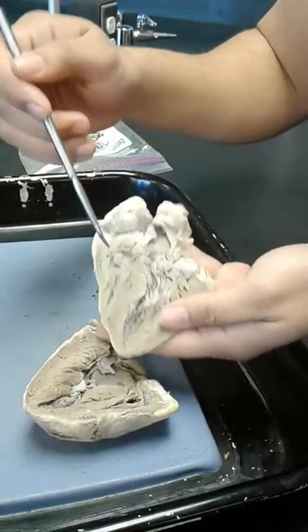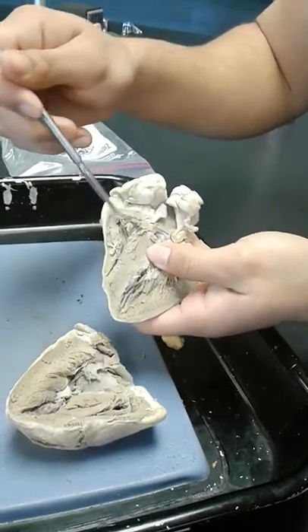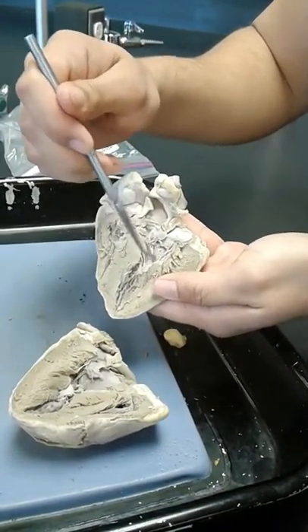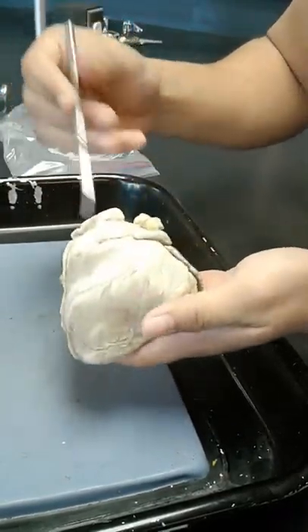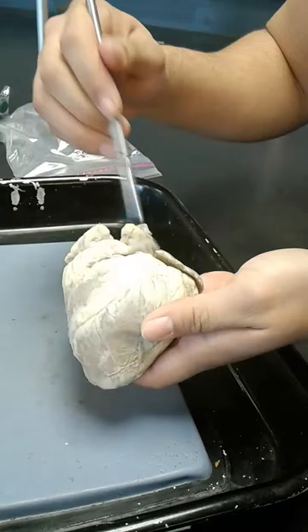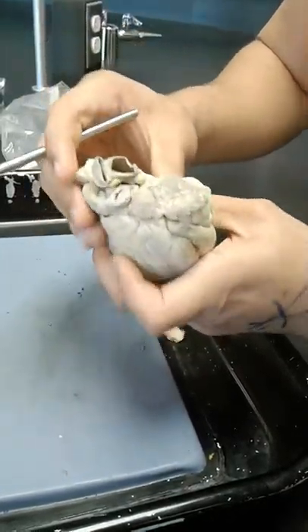In overview: right atrium, right ventricle, left atrium, left ventricle, chordae tendineae, tricuspid valve, bicuspid valve, papillary muscles. This is the apex of the heart, and here is the left coronary artery and the circumflex, right here. And I believe these are auricles, these two. And that is it. Thank you.